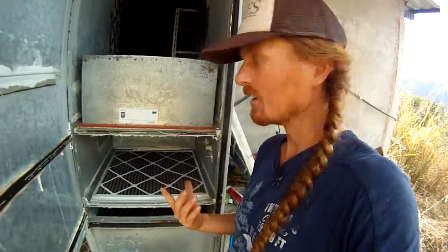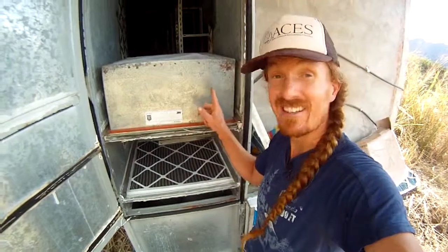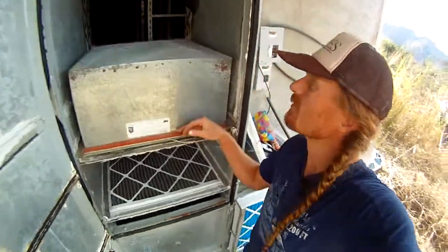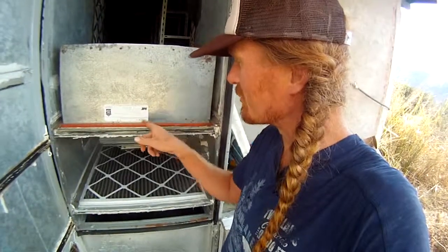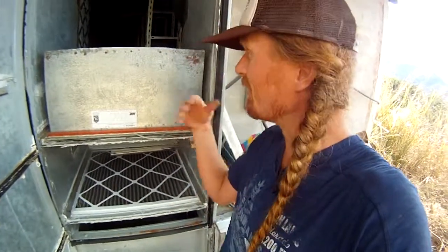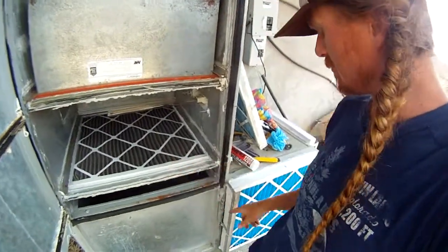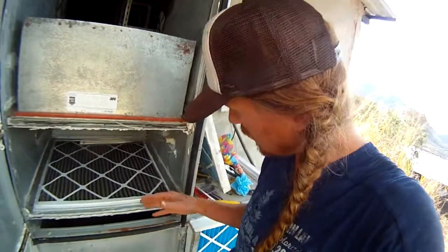All right, so what's behind the door? Bang. This is the push side of the filtration system. This is another pre-filter, and this is the HEPA filter. Boom, thick, beefy, true HEPA filter. This thing is a foot thick of glorious happiness. As you can see right here, it's 99.99% efficiency. It says it's somewhere in here. Just trust me on that one. And yeah, this is the main thing. This is blowing out this way, and into the lab, where it's nice and clean. This other filter is not as thick, but it's rated, I think, at 60%. I'm not quite sure either, but it's a step up from this.